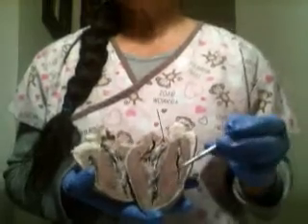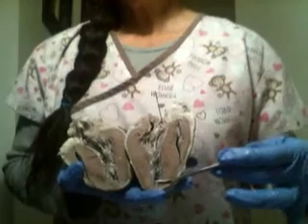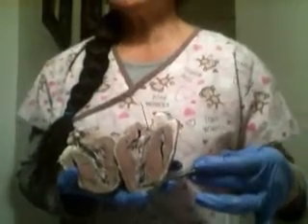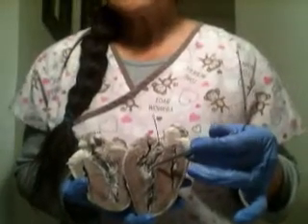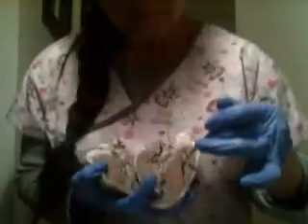Okay, now interventricular septum. It's this here. Okay, now bicuspid. It's the mitral or left AV valve. Okay, so it's here, and the right. Okay, this is the left AV valve, and this is the right AV valve inside here.